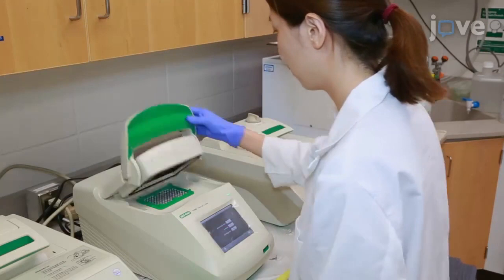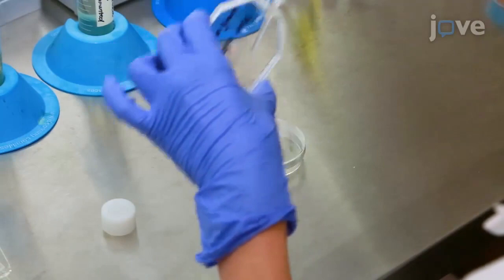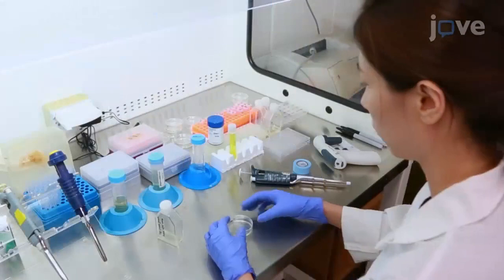Seed 2 mL of log-phase growth insect SF9 cell culture evenly to the wells of a cell culture plate. Then allow the cells to attach for at least 3 hours at room temperature in the hood. Using an inverted phase microscope at 250x, check the cell attachment.